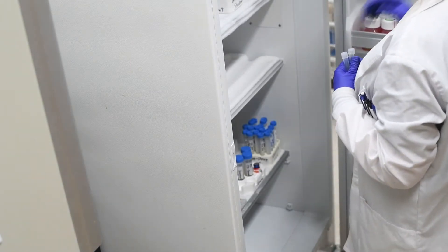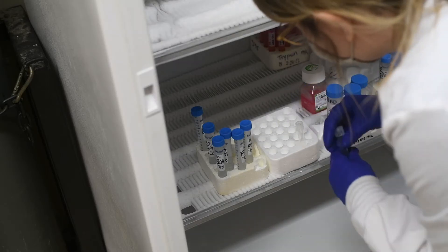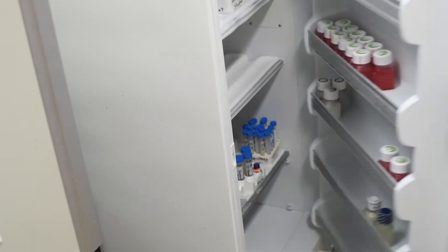I placed the tubes into a minus 20 degrees Celsius freezer for 3 hours while the cells were fixed in the ethanol. While the minimum fixation time is 3 hours, these cells can remain stable in the freezer for 2 to 3 months.